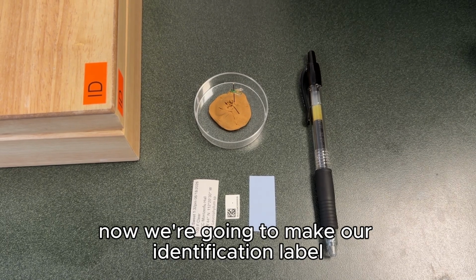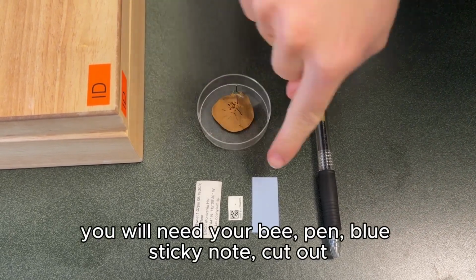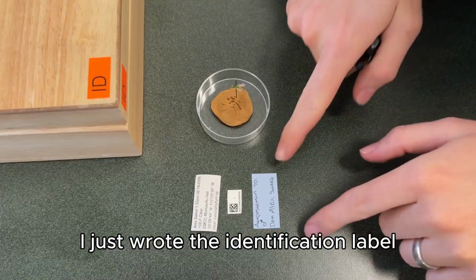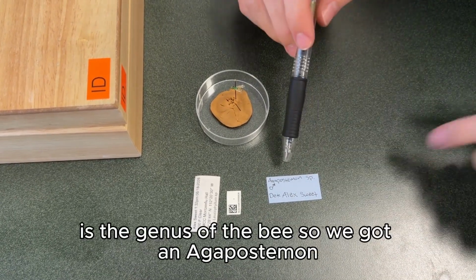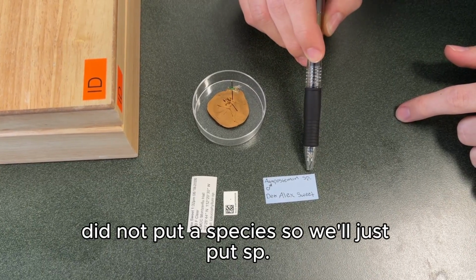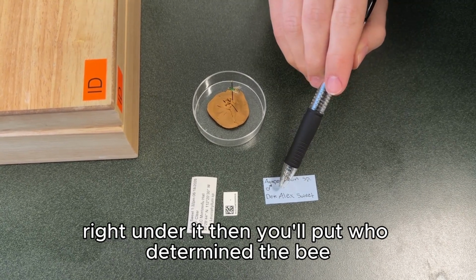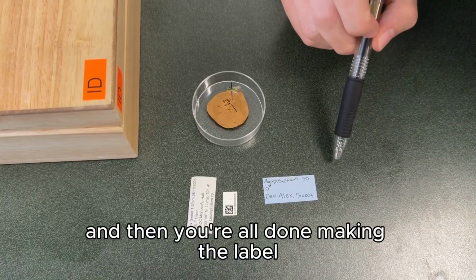Now we're going to make our identification label. You will need your bee, pen, blue sticky note cutout, and your information of your bee as well. I just wrote the identification label, and what you're going to write on it is the genus of the bee. So we got an Agapostemon. Did not put a species, so we'll just put SP period. Then we put the sex symbol right under it. Then you'll put who determined the bee, put DET, and then put your name, and then you're all done making the label.